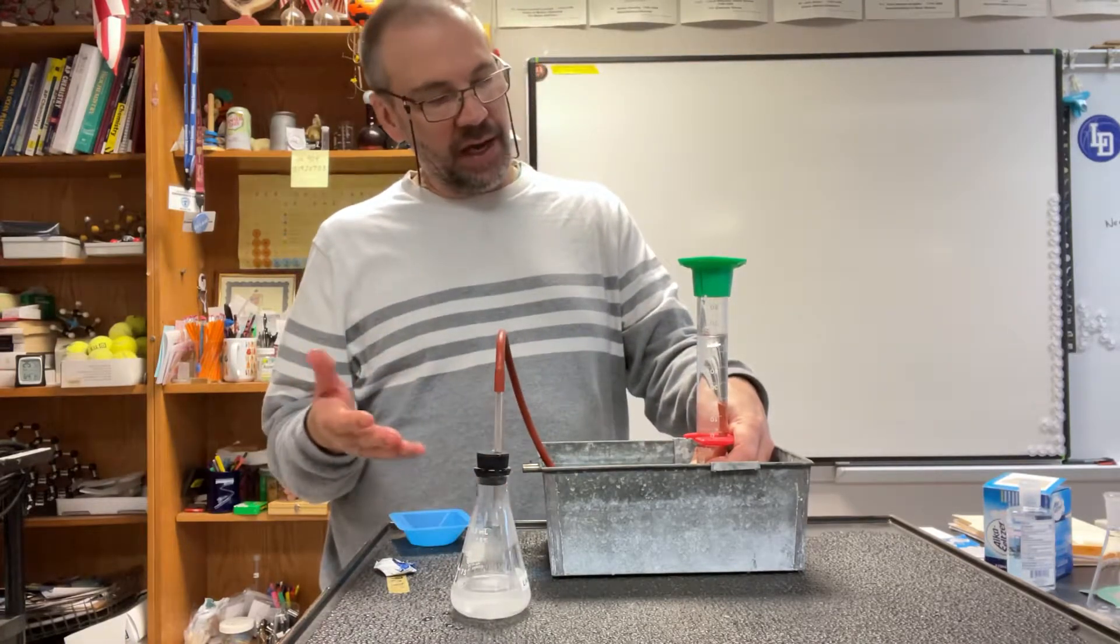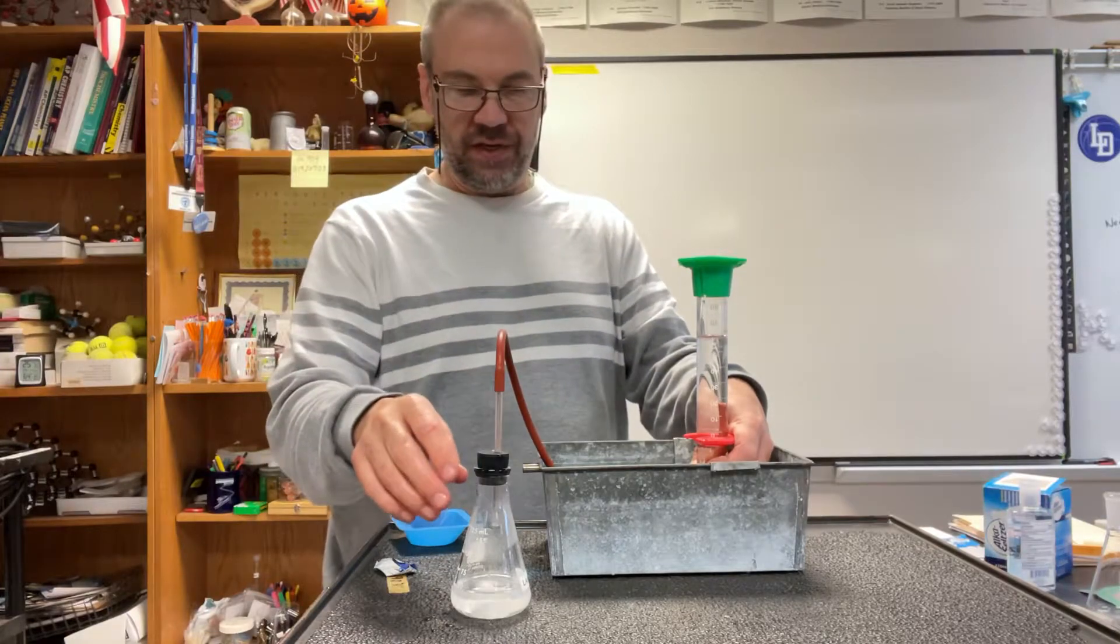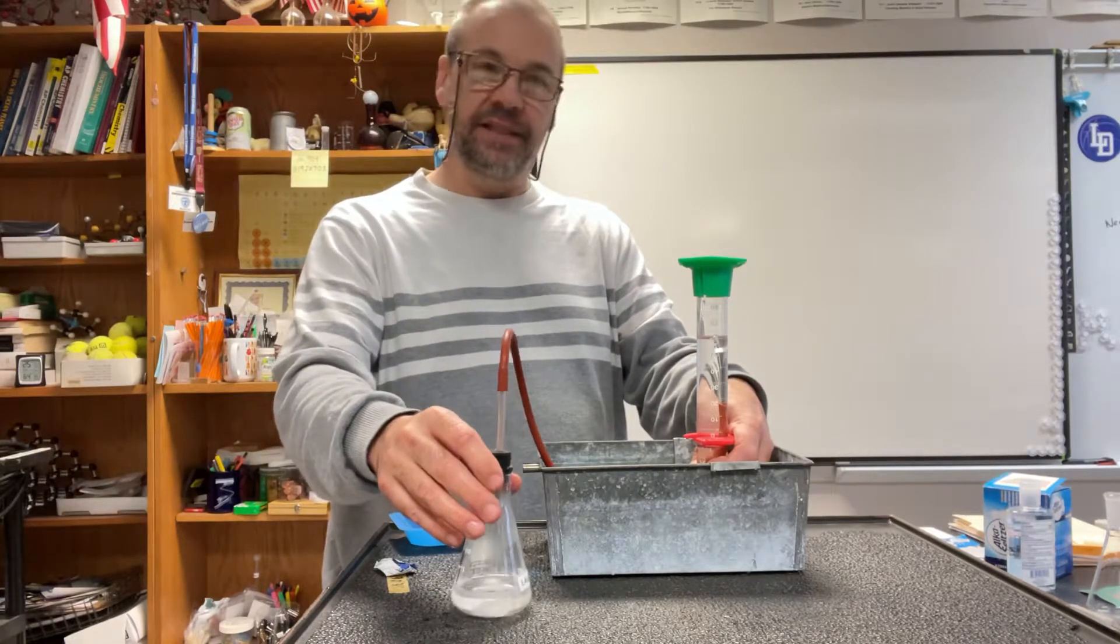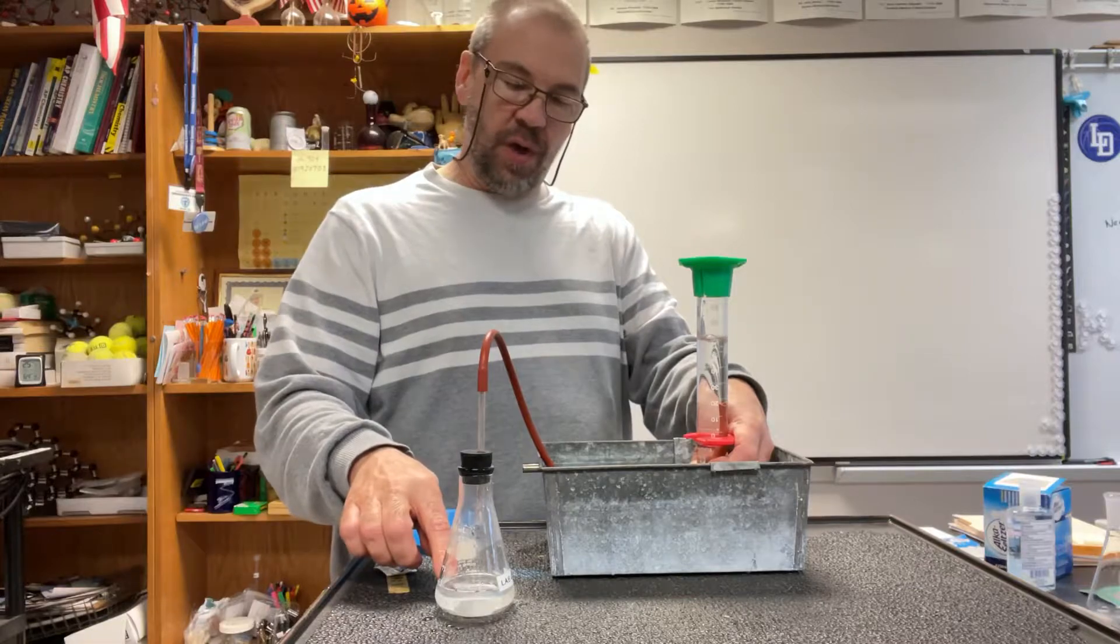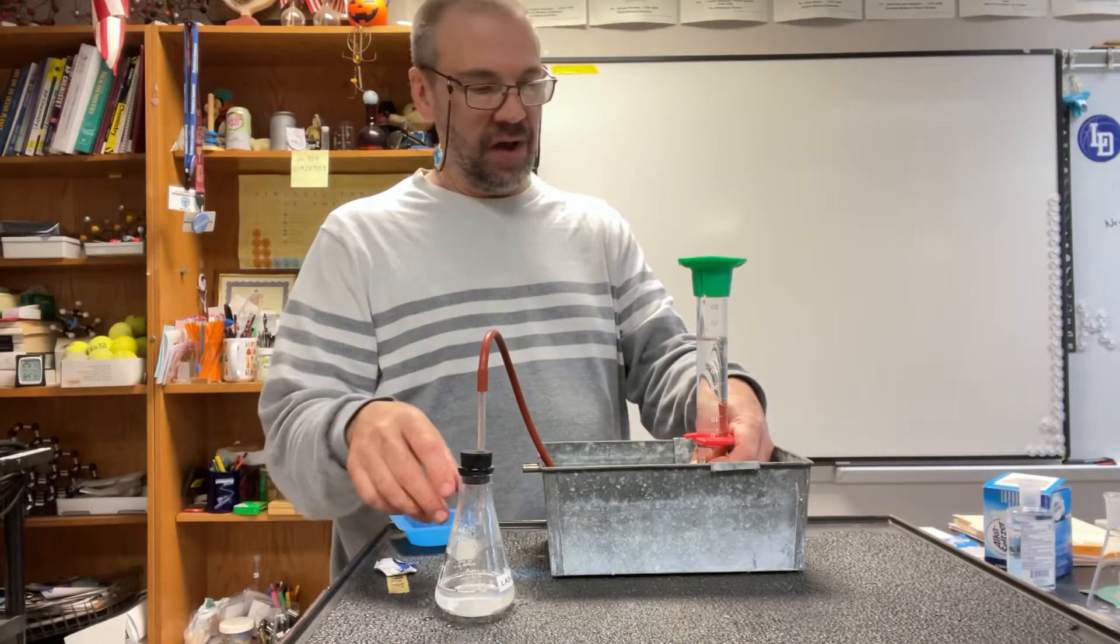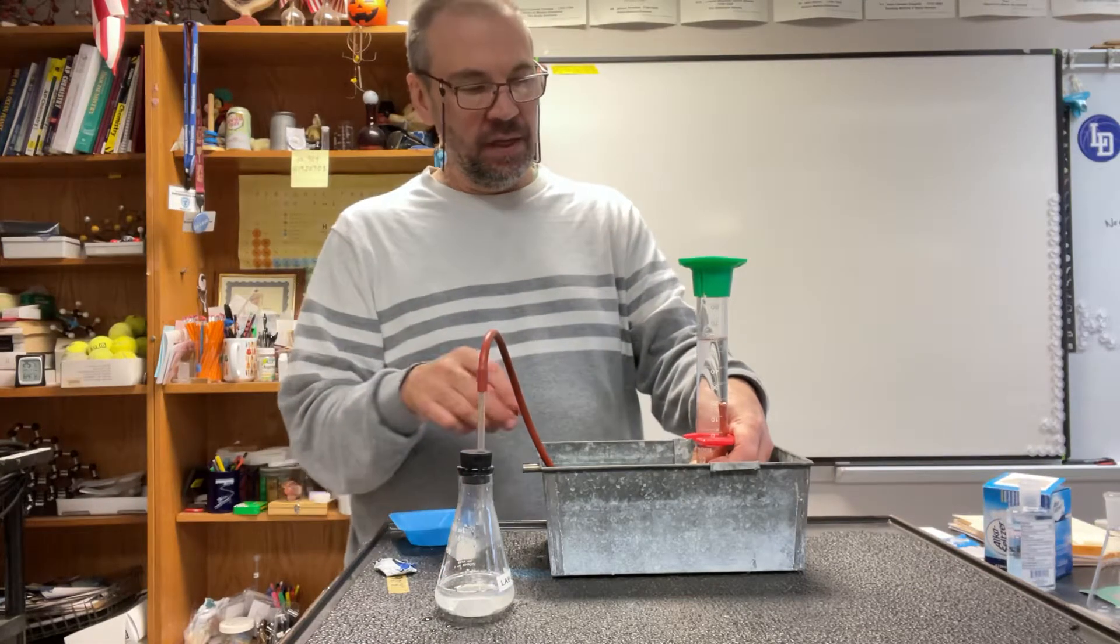Now you're going to need to try this a couple of times because there are some intricacies here and some details you have to pay attention to - how much water you have, how big is your Alka-Seltzer tablet, etc.